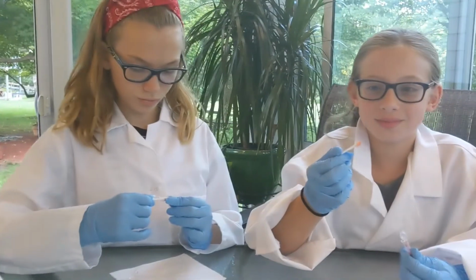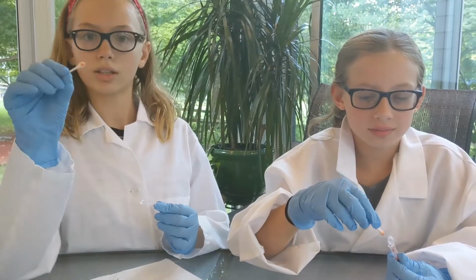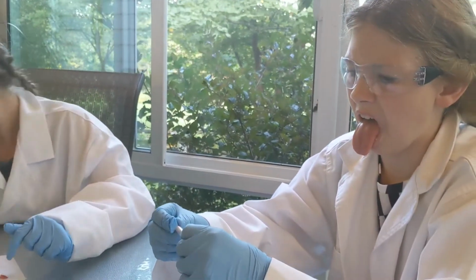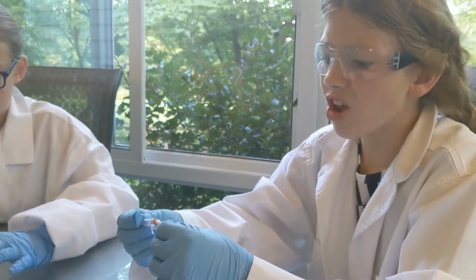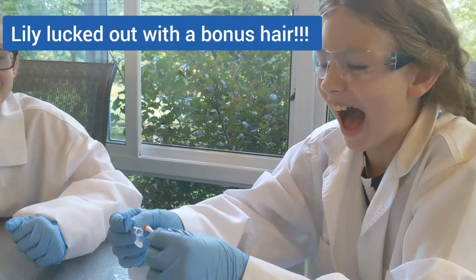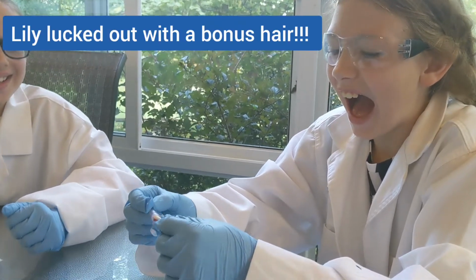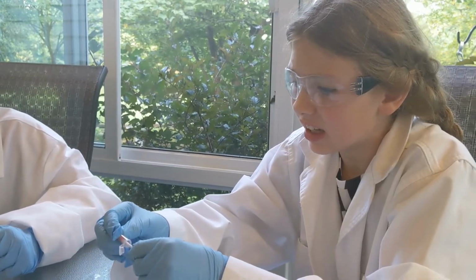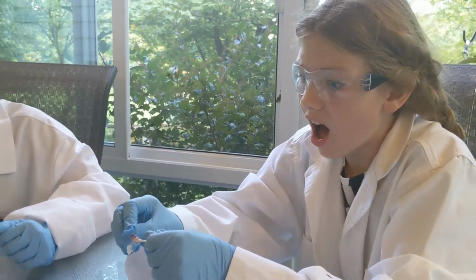Oh, there you go. You got a little color on there. I'm gonna go viral. Okay, now you can cap your... No, mine came with the hair. It's okay, put it back in. It's green. Okay, it's fine, it's fine. It can be on there and it'll all be fine. Okay, I guess it's next, part of the test.